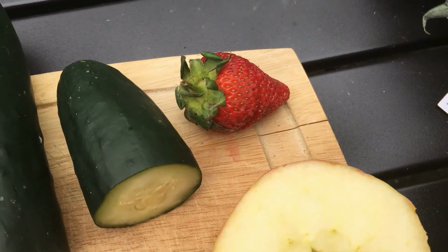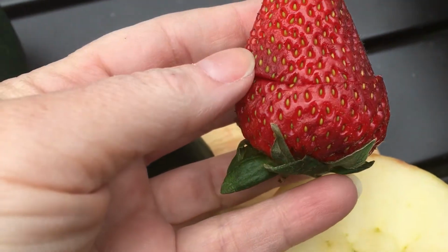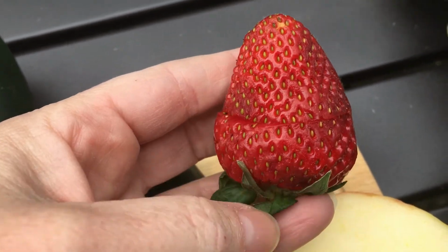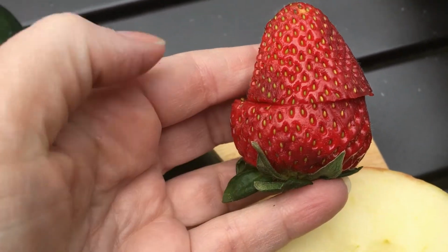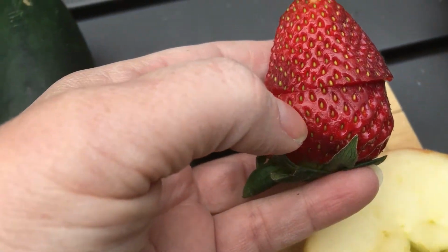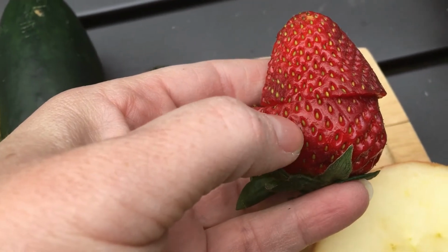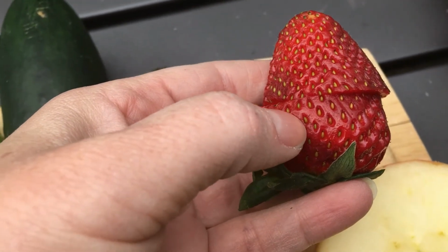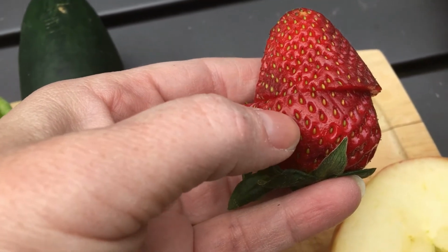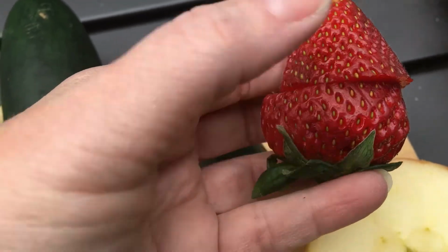And then we also have a strawberry. Remember, the strawberry is developing from mostly the receptacle tissue, so it would have sat in the flower this way. These would be the sepals down here on the bottom. The petals would have come out, they've fallen off. And this is the receptacle part that everything was attached to. Even the ovaries were attached to it, and that's what is now forming these little seeds, which are actually the whole fruit.